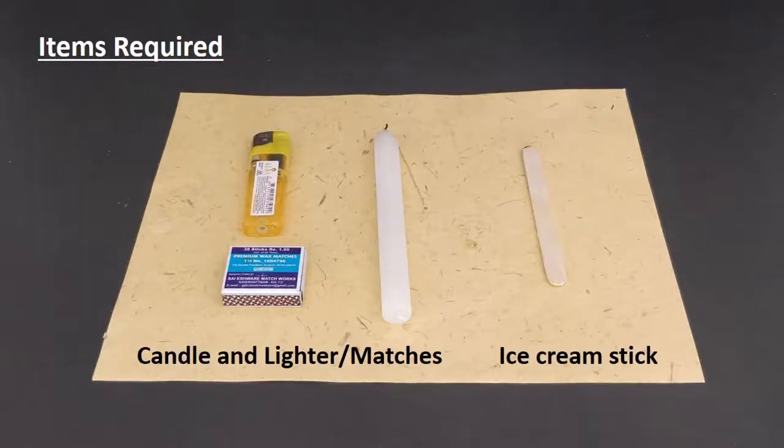To test the gas released during this reaction, we will use a burning ice cream stick. For this we will need an ice cream stick, a candle, and a lighter or matches.